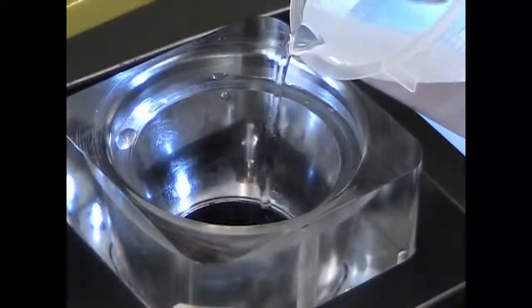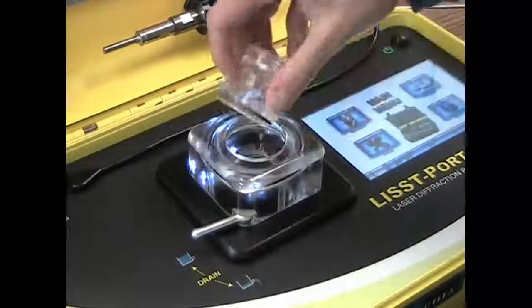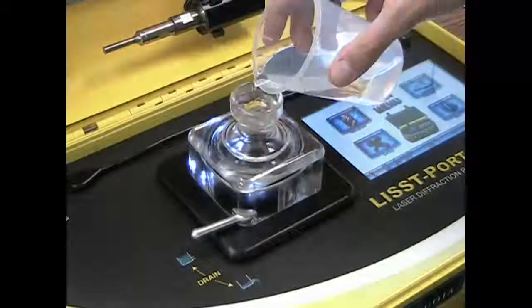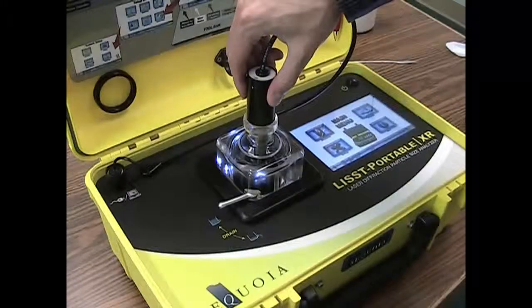The same procedure you just saw for filling the chamber with particle-free water should also be used for filling the chamber with a particle containing water sample.